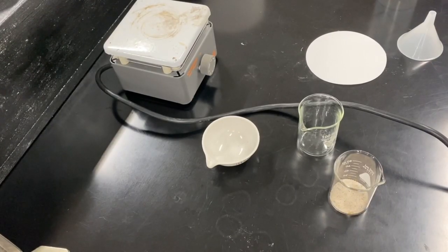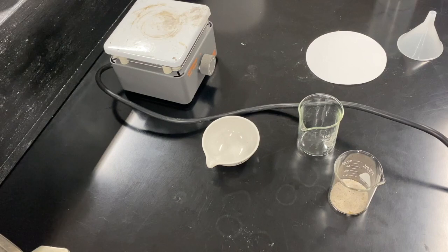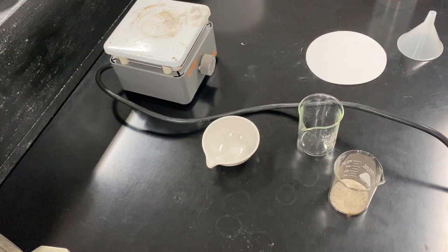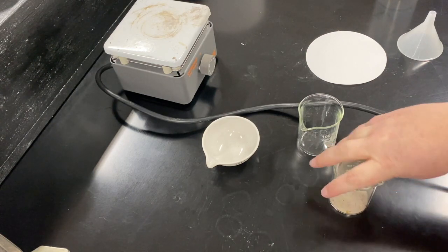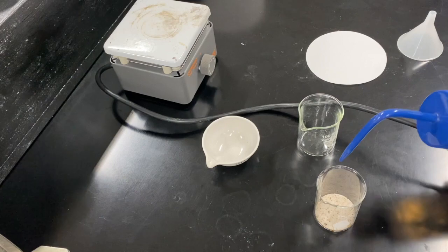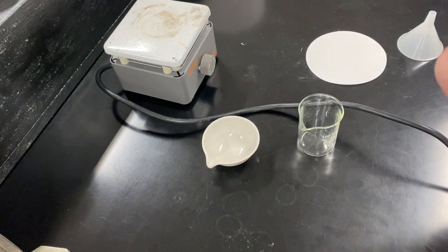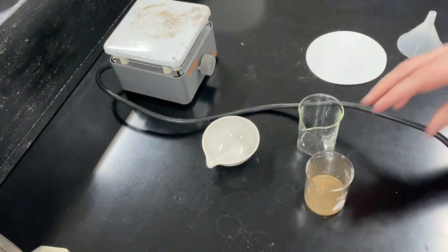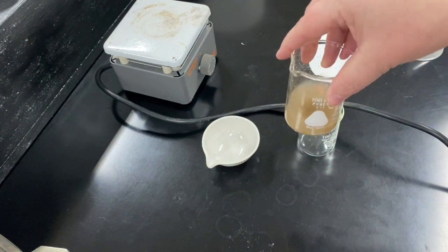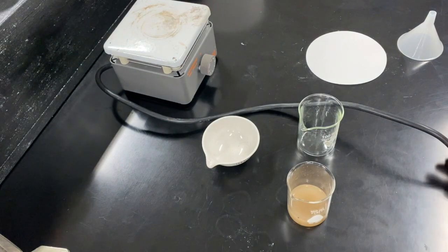We are going to continue our work on the chemical and physical changes lab, working on steps six, seven, and eight in Part B. Let's start with step six. I have our salt-sand mixture — about two scoops — and I'm going to add approximately 30 mL of water, swirling it to mix. We already know that the salt-sand mixture cannot be separated using a magnet, so let's see if we can use filtration.